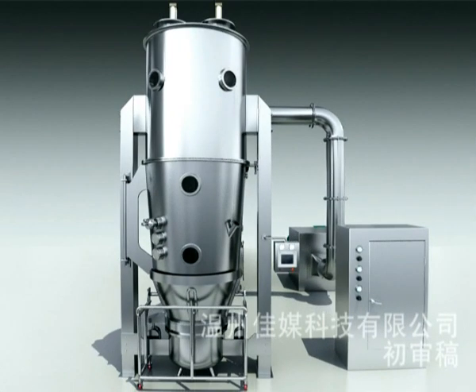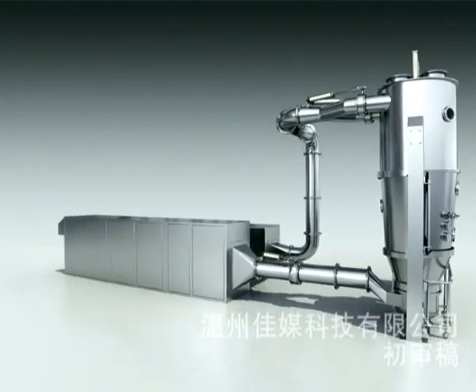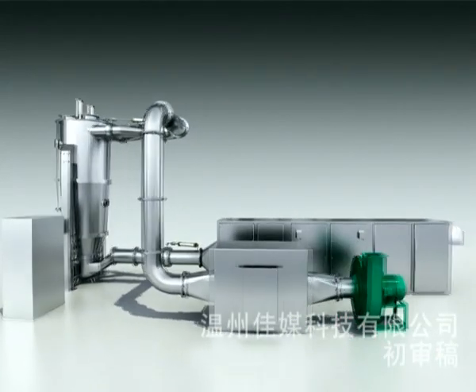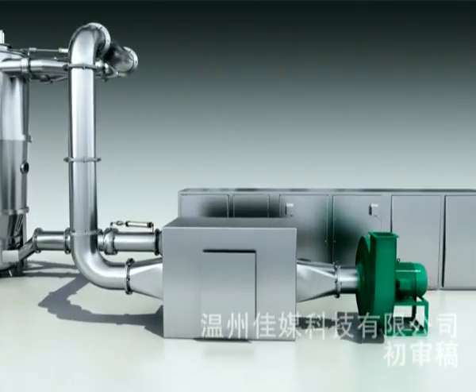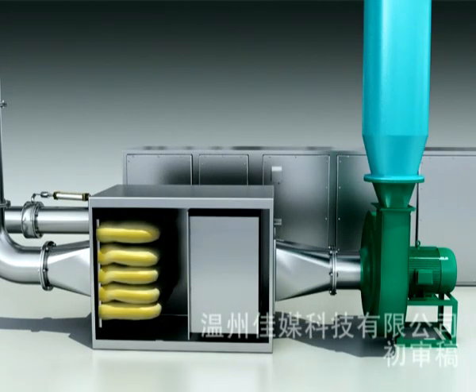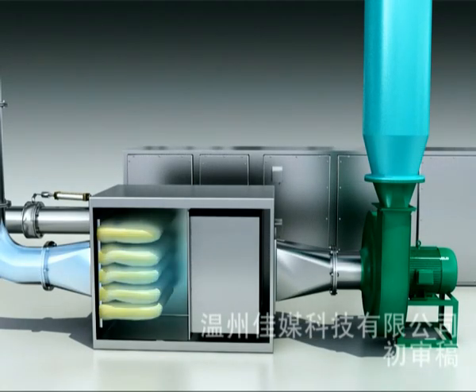Air exhaust system. The air exhaust system is normally placed in the technical room or auxiliary machine room. Construction material that can reduce noise is normally used for this room. The shock reducer under the fan should protect the fan from vibration as well as the floor of the building. For protection of the environment, post-filter, HEPA filter, or cartridge filter for exhaust air are available on request.